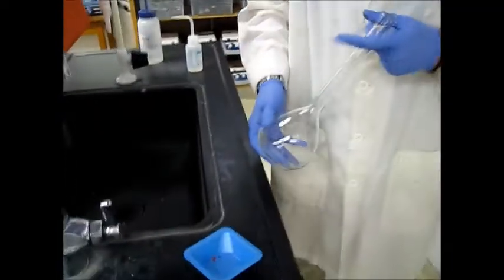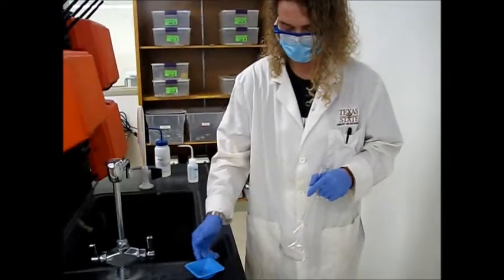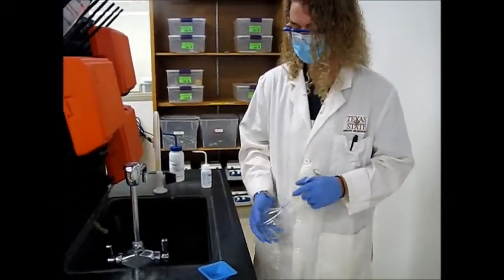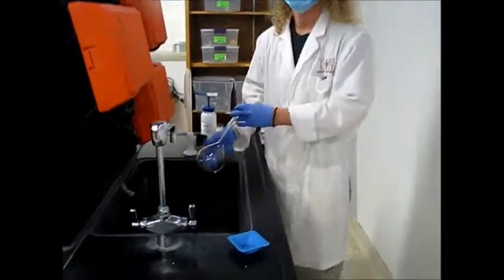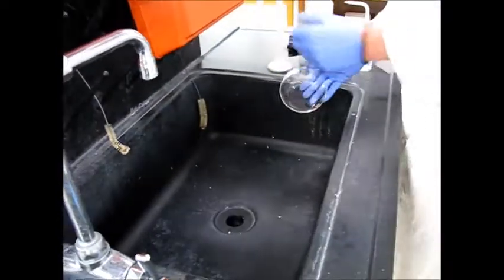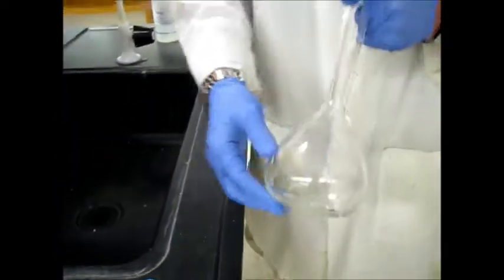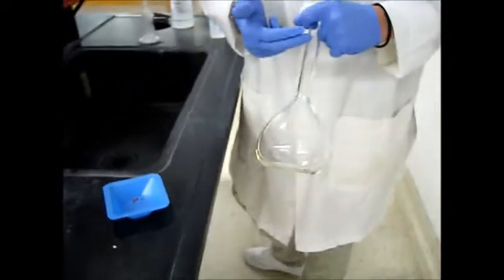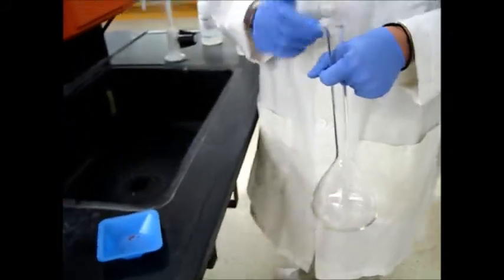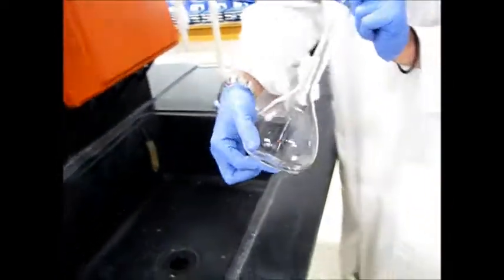So when you're making things quantitatively using really small amounts of solid and kind of big dilute amounts, you can make sure everything's very precise and very accurate. So you don't have any kind of errors in your calculation. So whenever you make quantitative solutions, you use volumetric flasks. First, we're going to add a little bit of water. Then add our solid and then dilute onto the line. You don't want to add the solid directly first. And it needs to be already in solution. Is it one liter or five? This is 500, 500 milliliters.